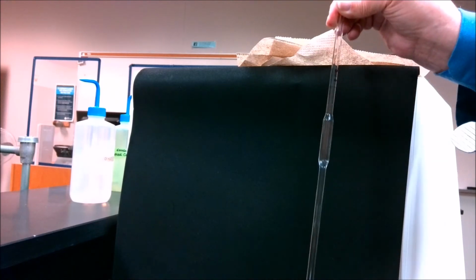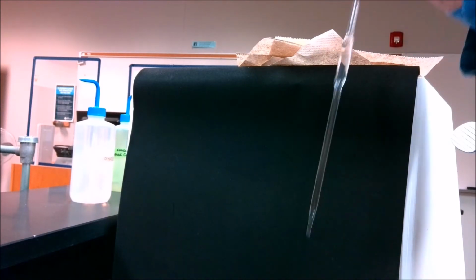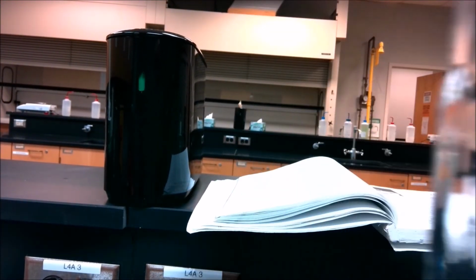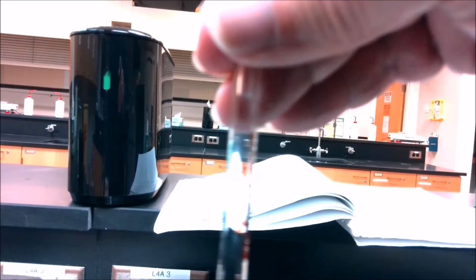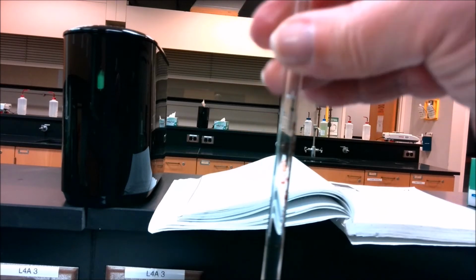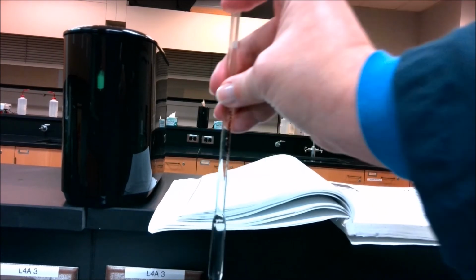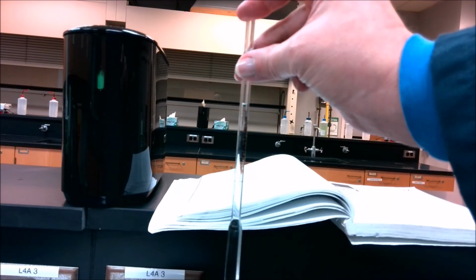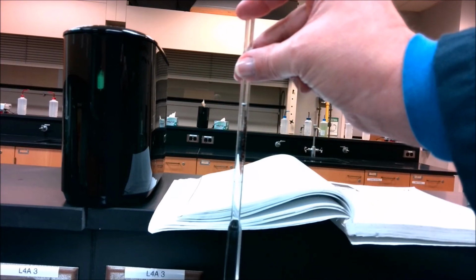Still working out some of the technology here. But you can see the line there; the liquid level is above that. What I'm going to do, holding the pipette above the reservoir that I took it out of, is carefully ease up the pressure of my finger till the liquid level slowly starts to drop.